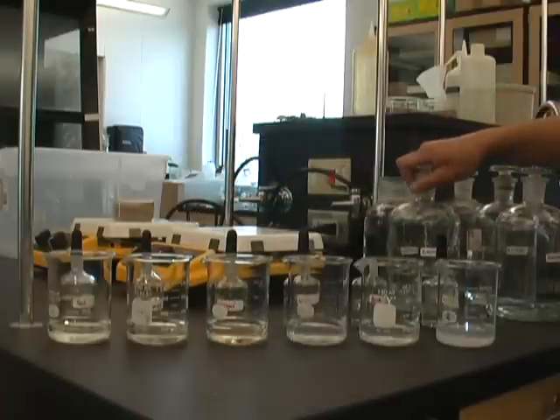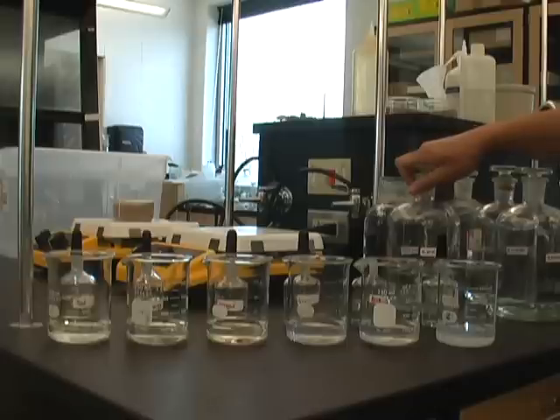I'm going to add sodium hydroxide, which is our base, and once the indicators indicate that there's more base than acid, it's going to change colors.